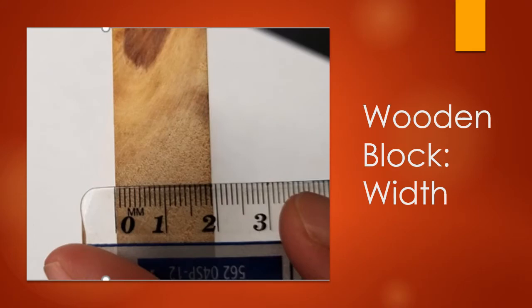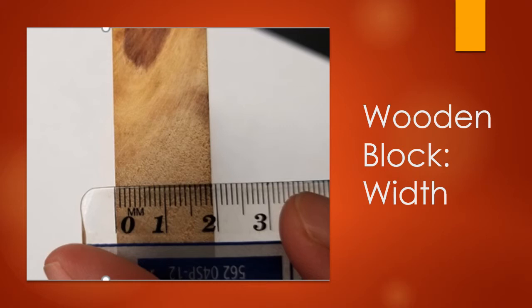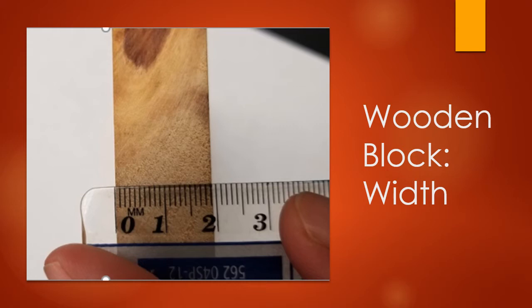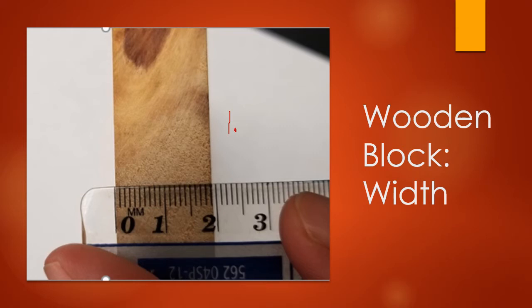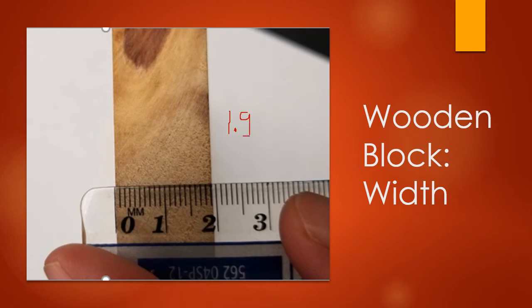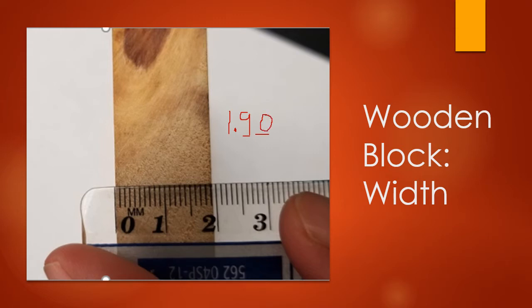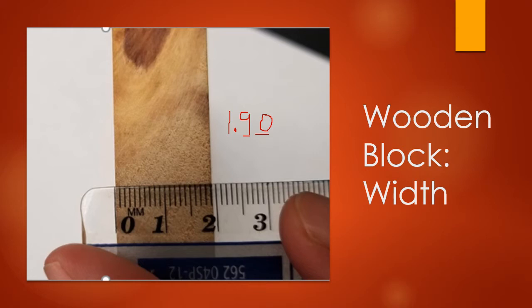Last but not least, the width. This one's a little bit easier to see given the clear ruler spanning that small distance. To me, it looks like the width is right at 1.9. If you get it where it's right on one of the dashes rather than between two, that's fine. But you still need to go out two decimal places to keep the correct number of sig figs. So if it's exactly at 1.9, write 1.90. Maybe you see a little sliver past, so you might write 1.91 or 1.92. Just make sure you are using the correct number of significant figures.